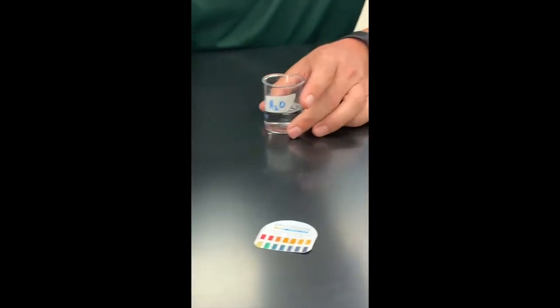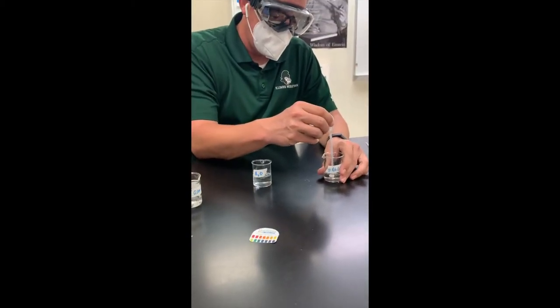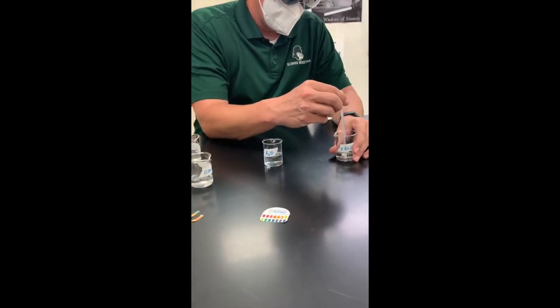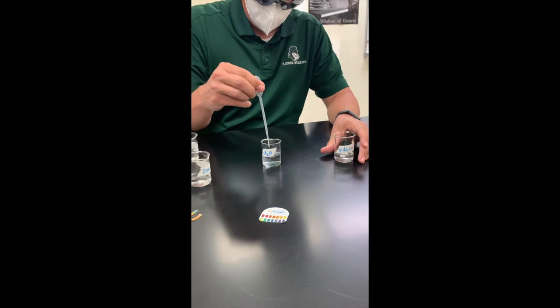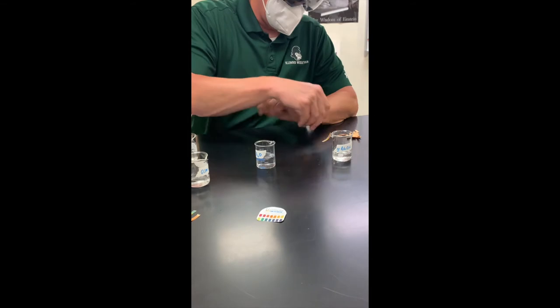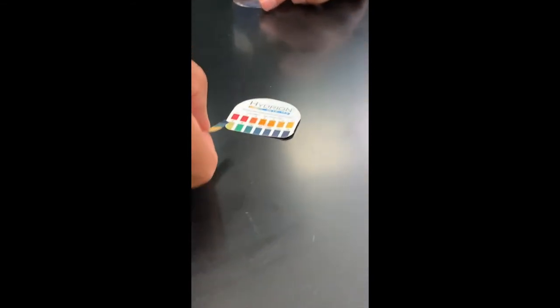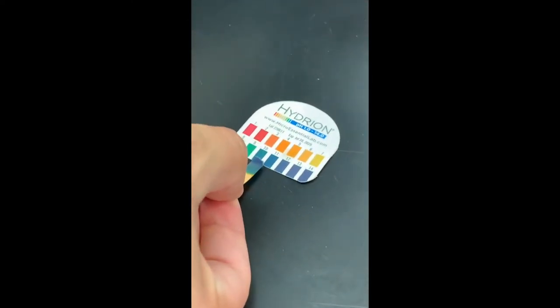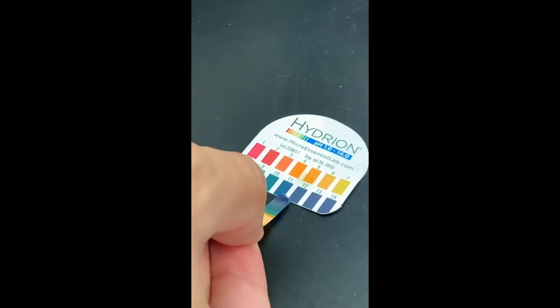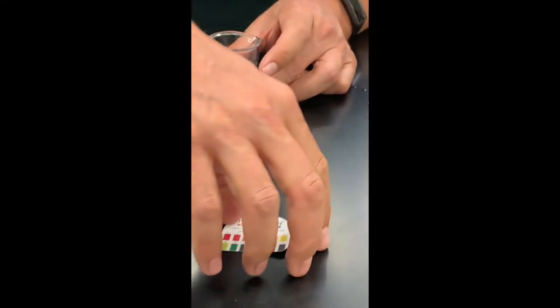So we're going to put that to the side. We're going to take another milliliter of 0.1 molar NaOH out of the container, add it, swirl, and take another measurement. And this looks to be somewhere between 10 and 11 — maybe more between 11 and 12. So we're somewhere between 11 and 12.